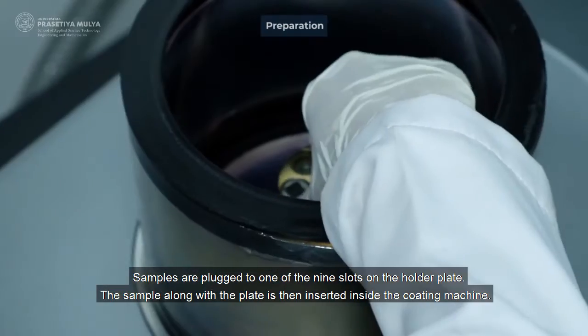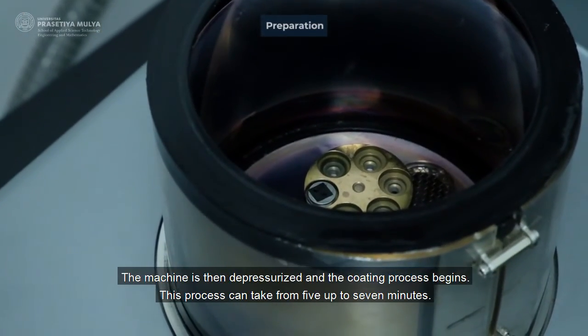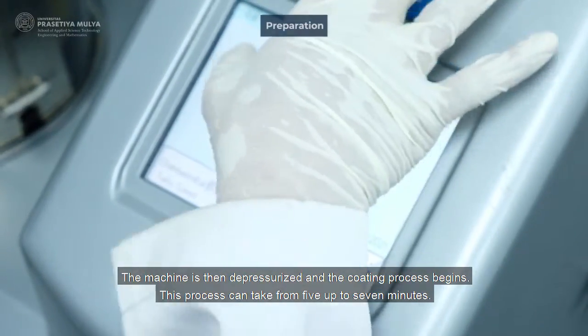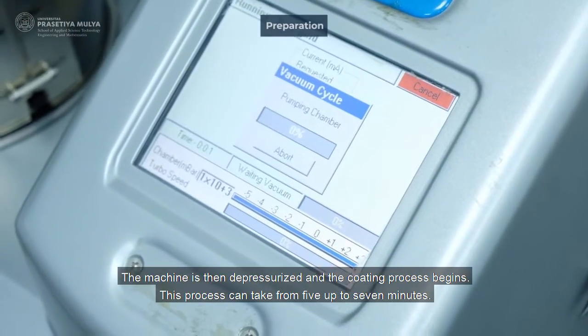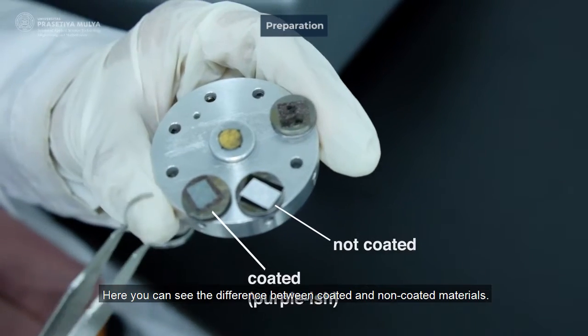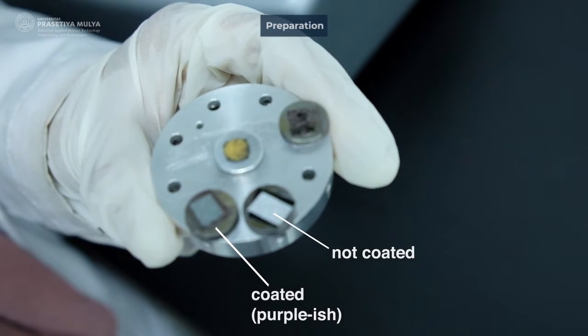The sample, along with the plate, is then inserted inside the coating machine. The machine is then depressurized and the coating process begins. This process can take from 5 up to 7 minutes. Here, you can see the difference between coated and non-coated materials.